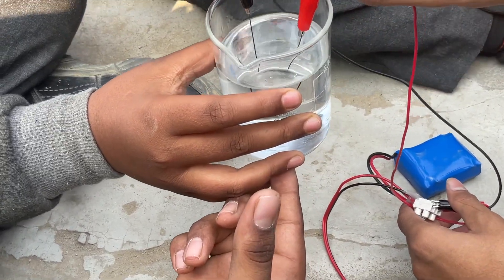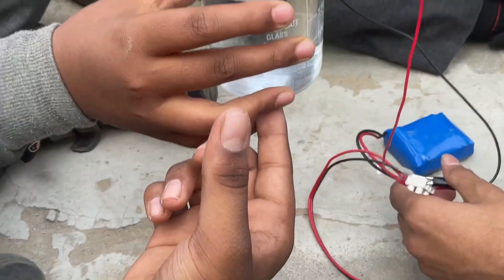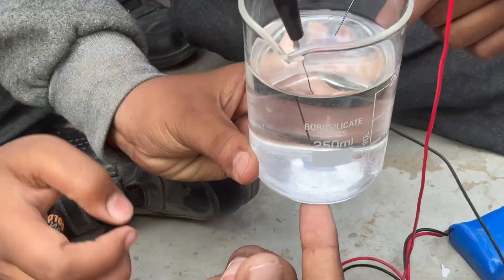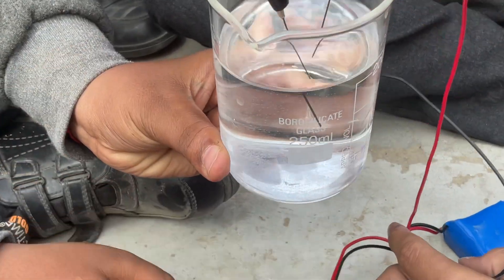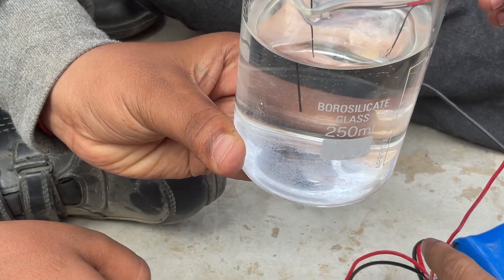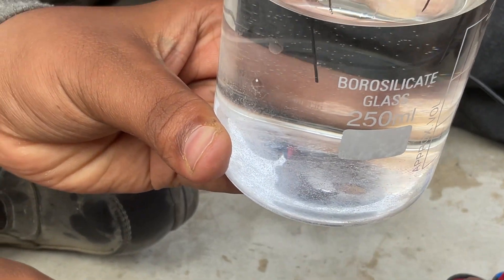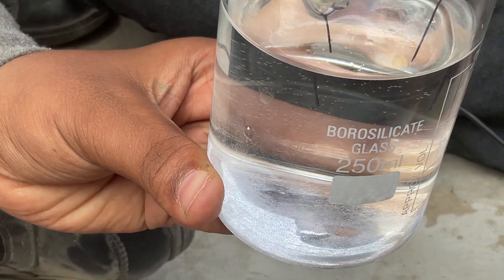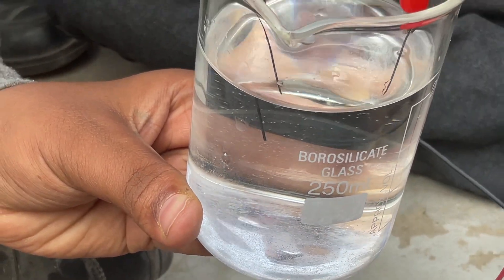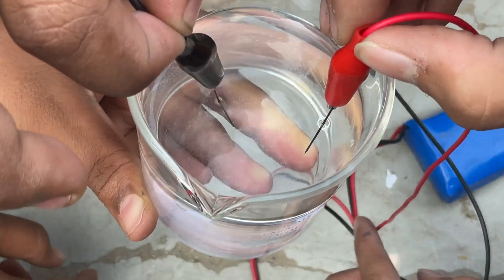Let's see — minor bubbles. You can see there is bubble formation. There is a bubble. You can see — black terminal — hydrogen gas formation.